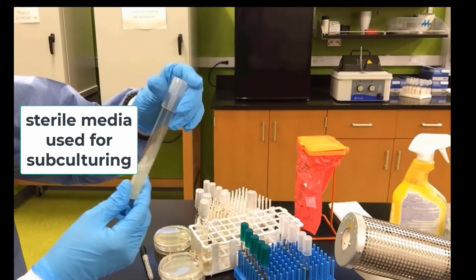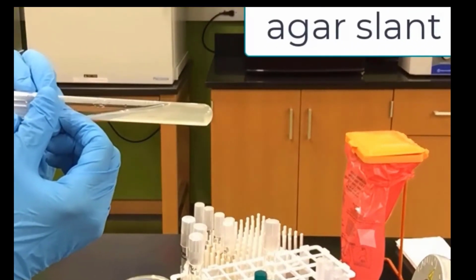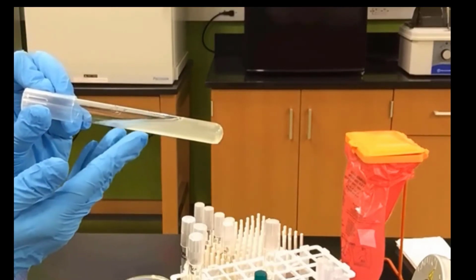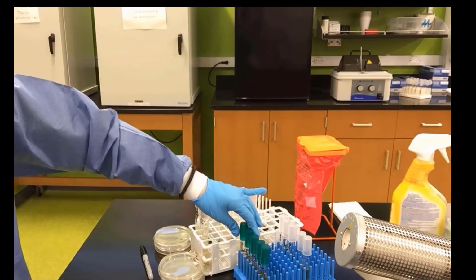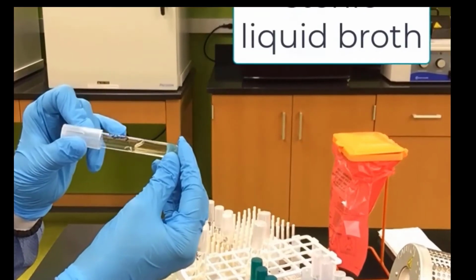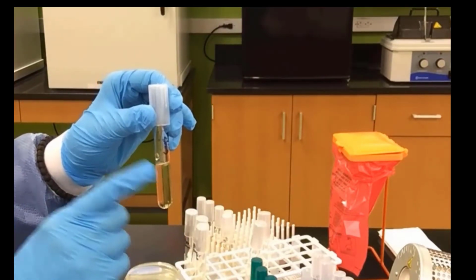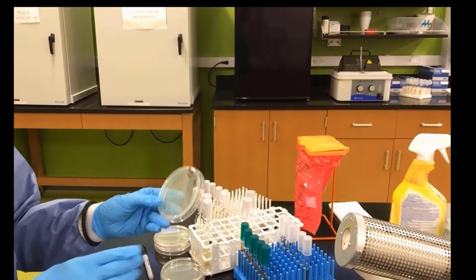Now the sterile media that we're going to use for subculturing will be a sterile Agar Slant. You can see it's slanted. This is a solid agar that carries nutrients for bacteria to grow on the surface. Each bacterium will have one of these agar slants. We have a sterile liquid broth. You can see it's liquid when we slightly tilt it. We will also put each bacterium into a liquid broth. This is also called subculturing, if you remember, when we transfer bacteria into media.